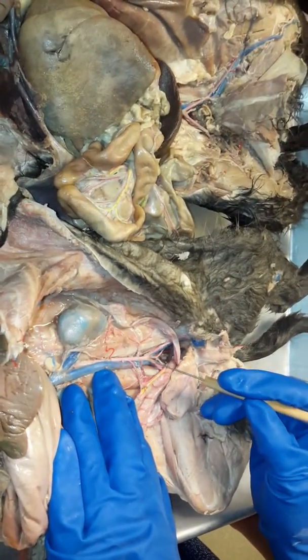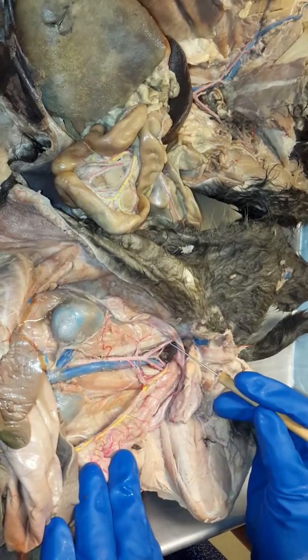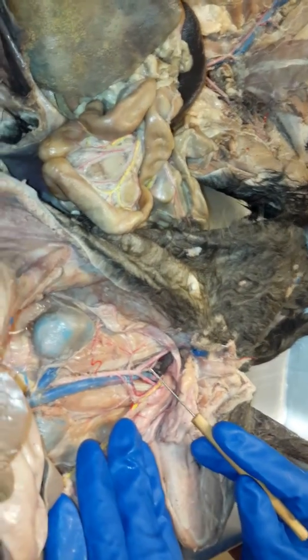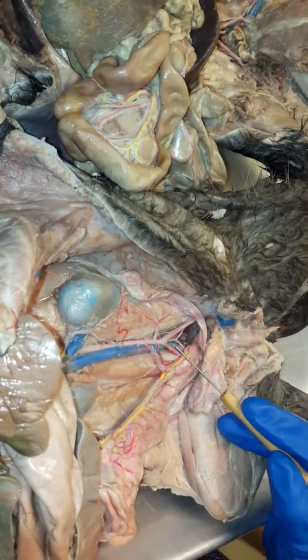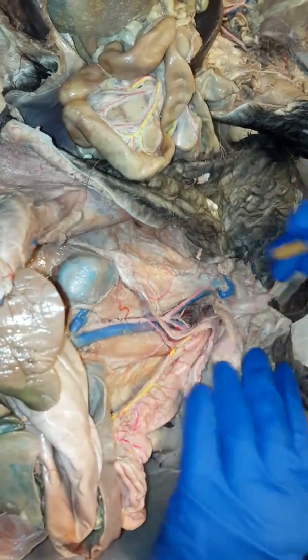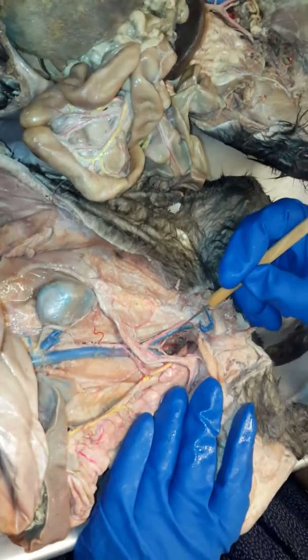So yeah, it's kind of hard to see where they initially branch, but you can see that there are two main blue branches coming off, right? Okay, so when the inferior vena cava initially branches, it's going to branch into the left and right common iliacs, okay? So left and right common iliacs. And this one is kind of hard. You might have to take turns with your camera. So I'm going to follow the left side. It's the same thing on the right, though.